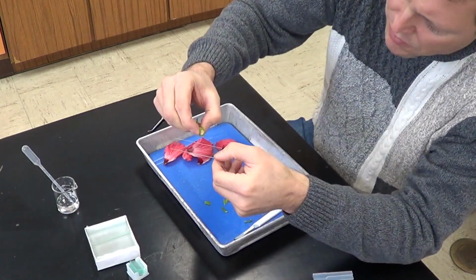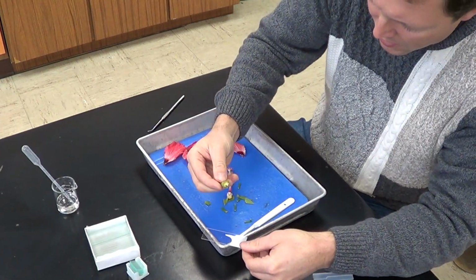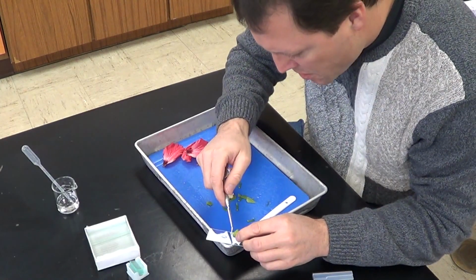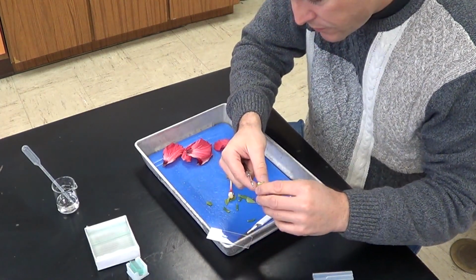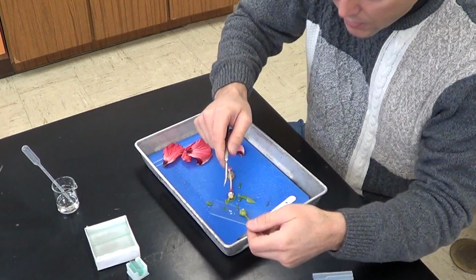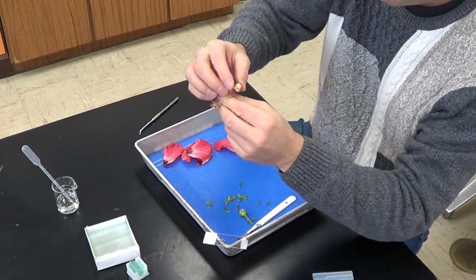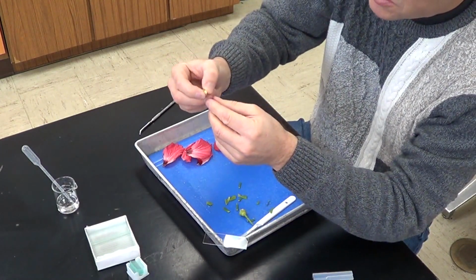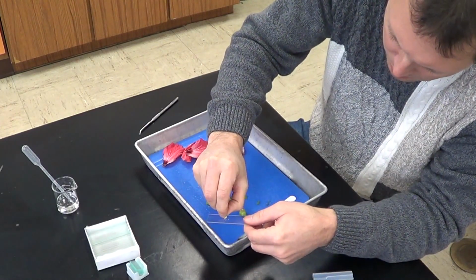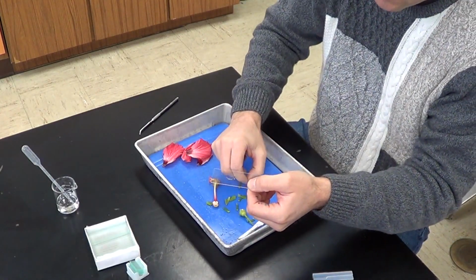And I'm going to take a few of these ovules and I'm just going to squeeze them onto this glass slide. Maybe with the help of my probe, I can get some of these ovules on here. And I've got one ovule on there. I can actually take the other half of the ovary and do the same thing to it. You can see the ovary right there. If I squeeze it, again, some ovules begin to come out. And now I've got two ovules on there.